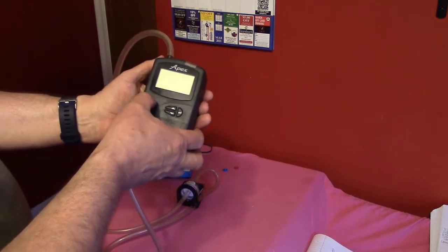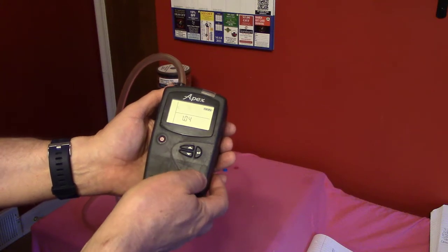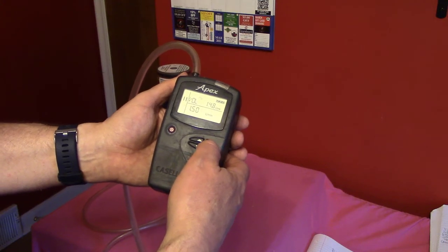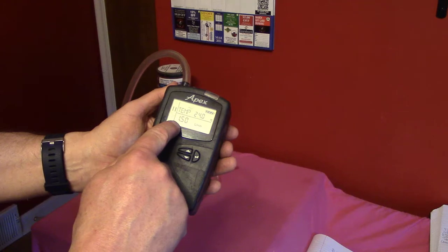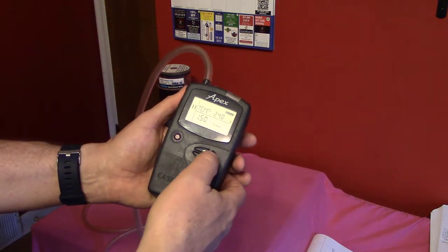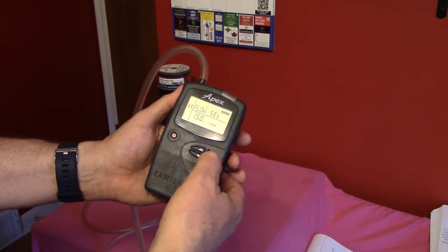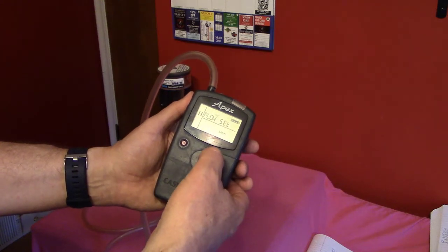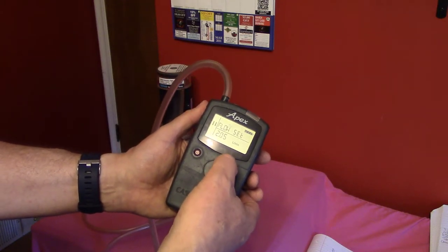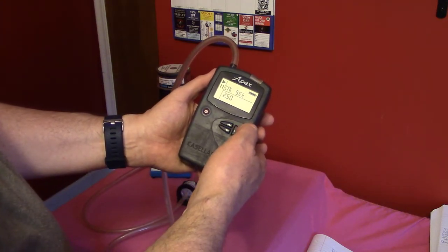Now I'm going to turn on the pump. It takes a little while to go through its warm-up. I can see that the flow says 1.50 liters per minute, and we're hoping for 2.50 liters per minute, so I have to change that setting. I'll get into the flow set menu, hit enter, and change the flow up to 2.50 liters per minute, then hit enter.